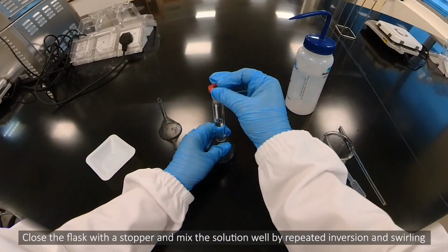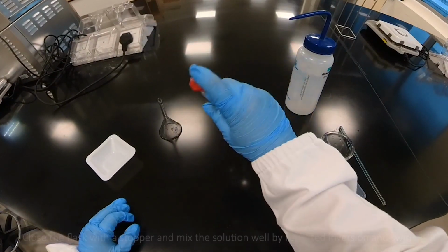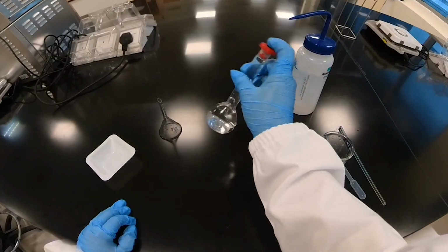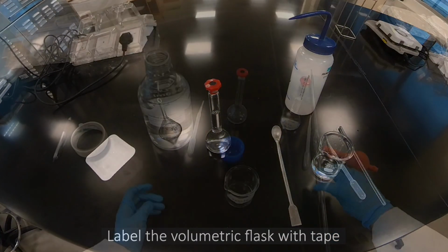Close the flask with a stopper and mix the solution well by repeated inversion and swirling. Label the volumetric flask with tape.